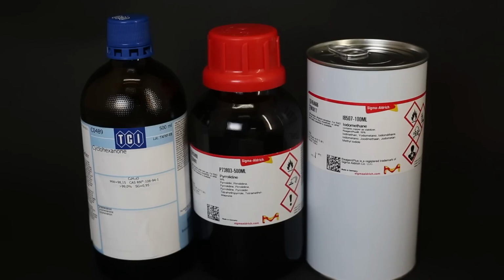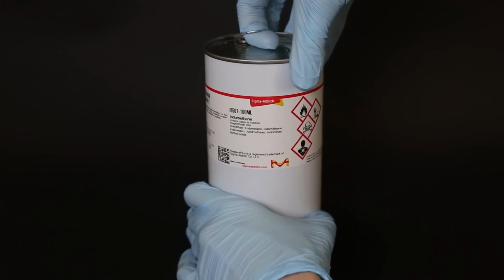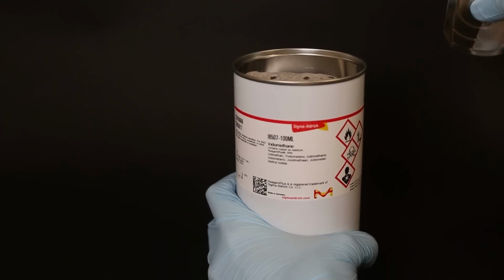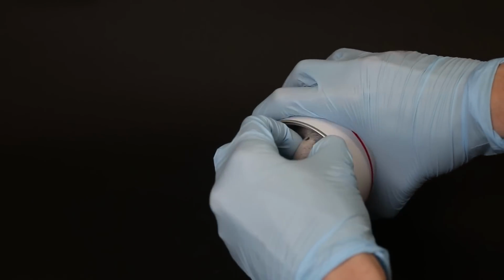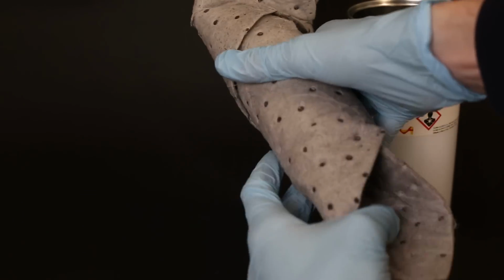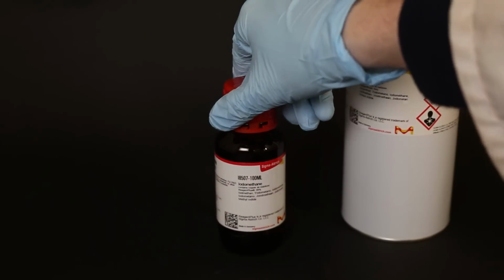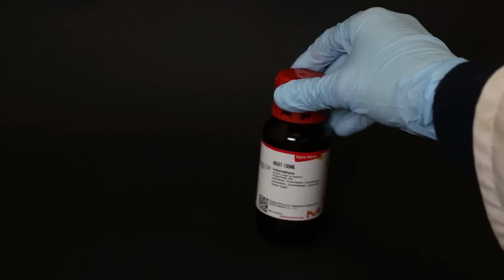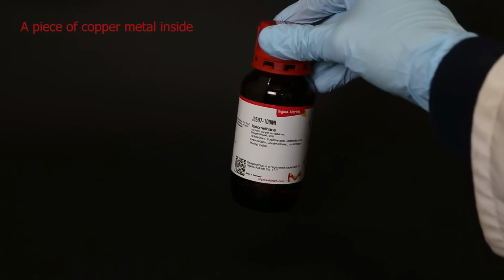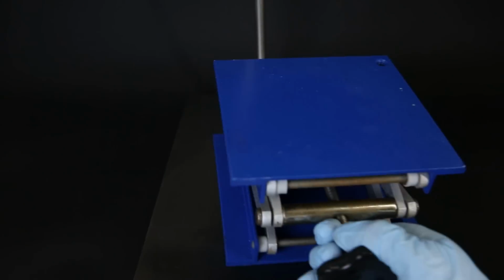So these are the three main reactants that I will use for this reaction. First, I will open the can that contains the methyl iodide bottle. Now, I will build a Dean-Stark trap before I can start the reaction.